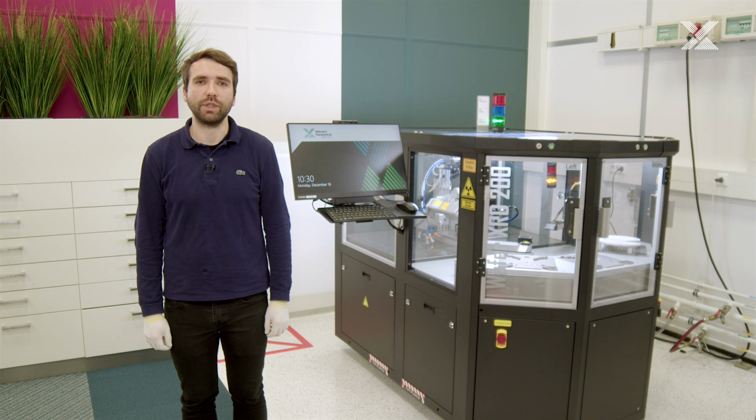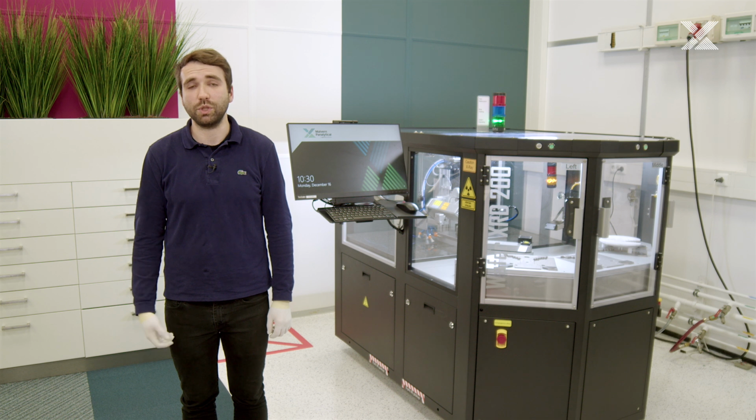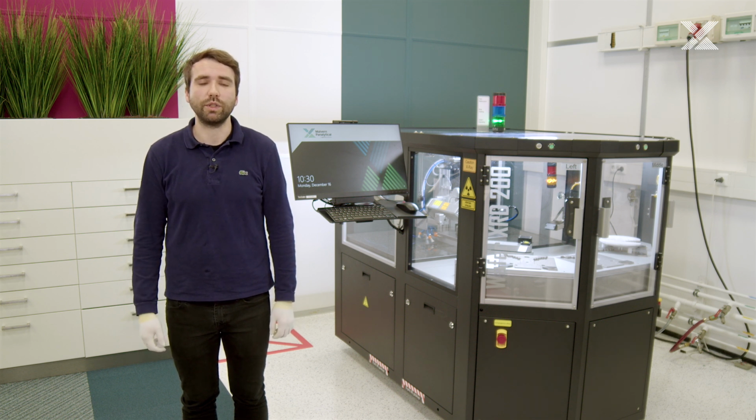I would like to show you today one of our systems, which is the Wafer XRD 200. It is one of the systems in our product line for crystal orientation, with some differences. As with other systems, it uses the Azimuthal algorithm for crystal orientation, which is much faster and more precise than the classical rocking curve method, which is time costly, which we cannot afford if we would like to do high throughput quality control of wafer substrates.